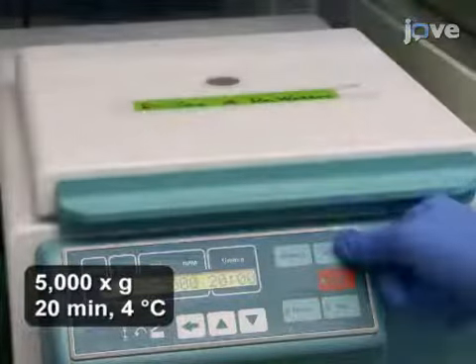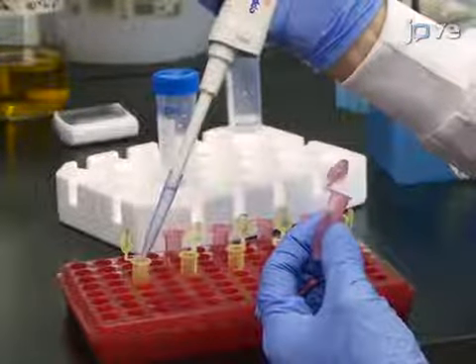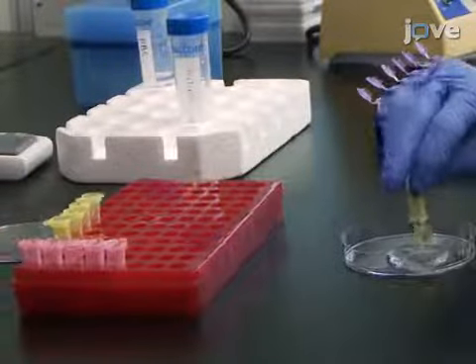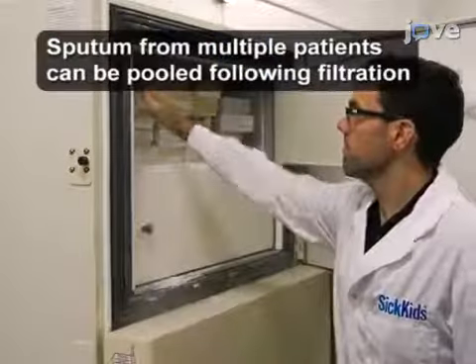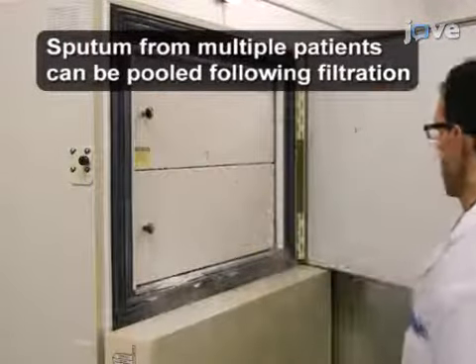Then, spin down the tubes. Following centrifugation, save the supernatant and discard the pellet. Filter sterilize the supernatant through a 0.22 micron filter and collect it in a clean microcentrifuge tube. Store the sputum supernatant at -80 degrees Celsius for future use.